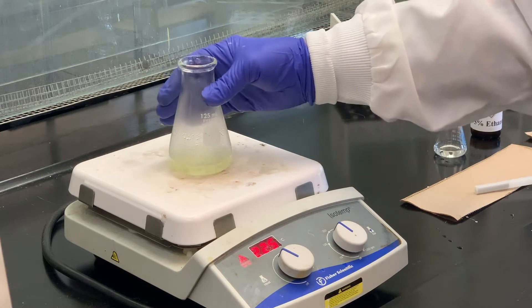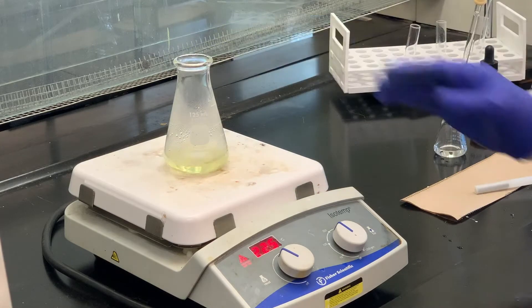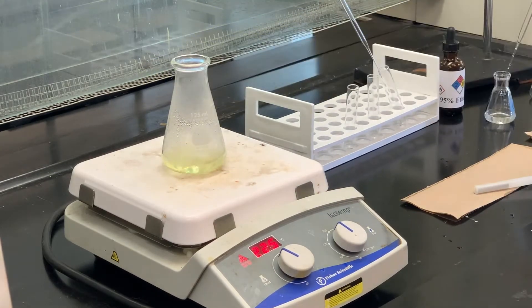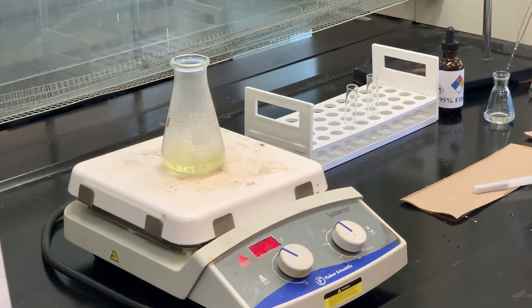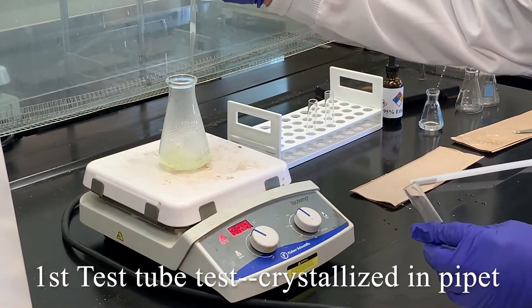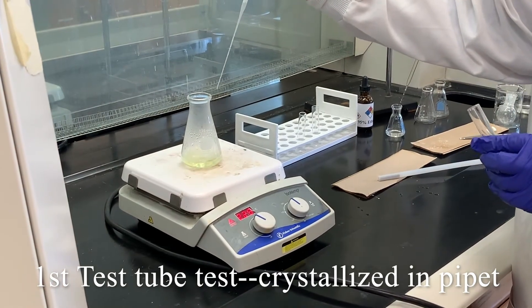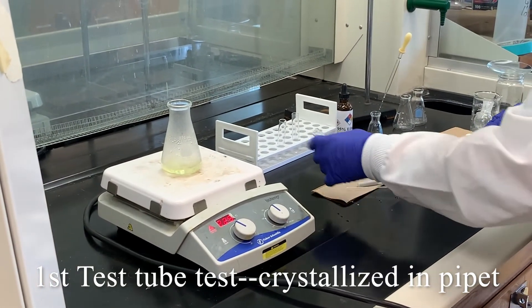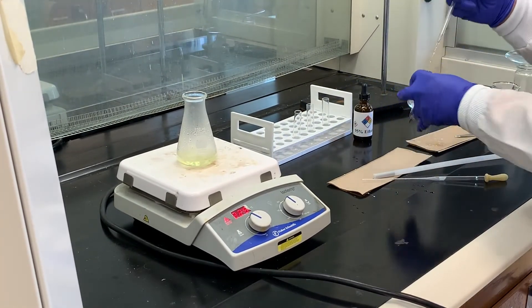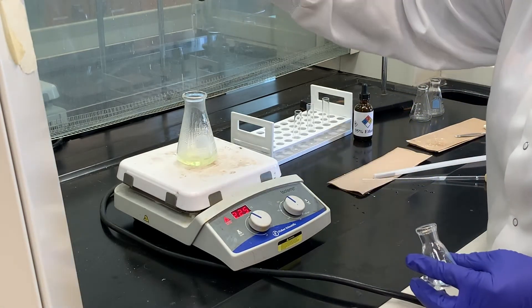More of the solid has dissolved — there's still a little bit left. Now it looks like mostly everything has dissolved, so I want to do the test tube test for recrystallization. I'm going to pull some of this up — do you see how it automatically crystallized? That's too fast. So I'm going to add more ethanol, because I don't want it to fall completely out of solution as soon as I take it off the hot plate.